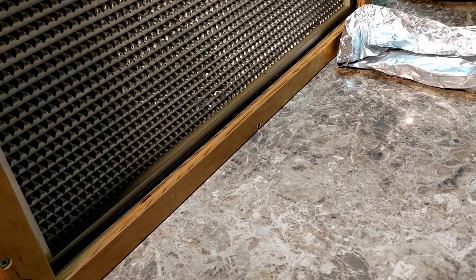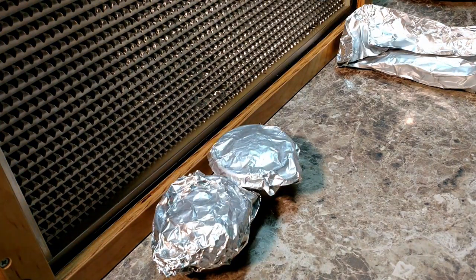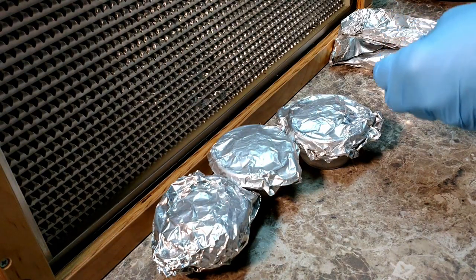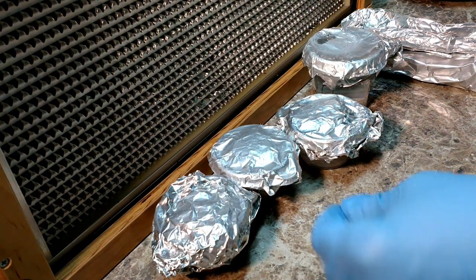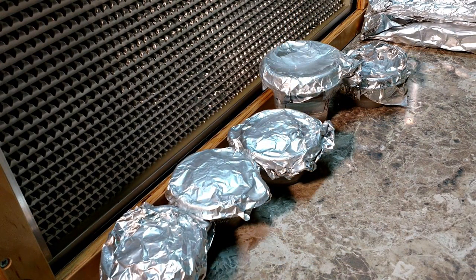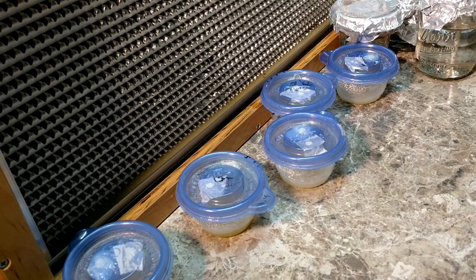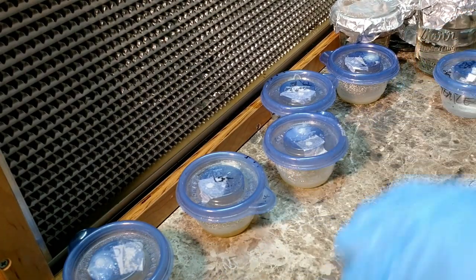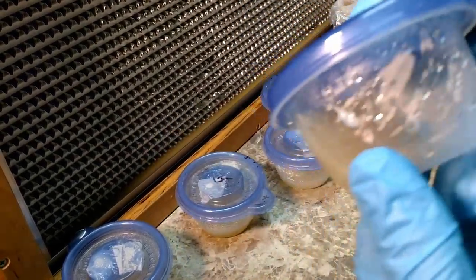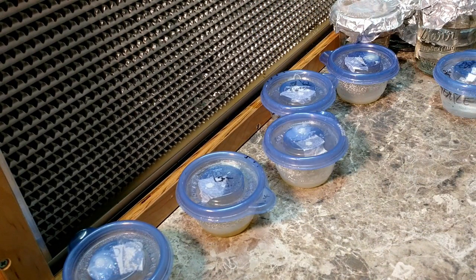Two or three syringes. We'll see — what we're looking for are the petri plates here. We have one filled over, we may not be using that. Everything in a sterile zone as much as possible. There's some water. And that one — this is what happens when it goes sideways, in the dish or in the PC — that one's not really usable, we'll take it out.